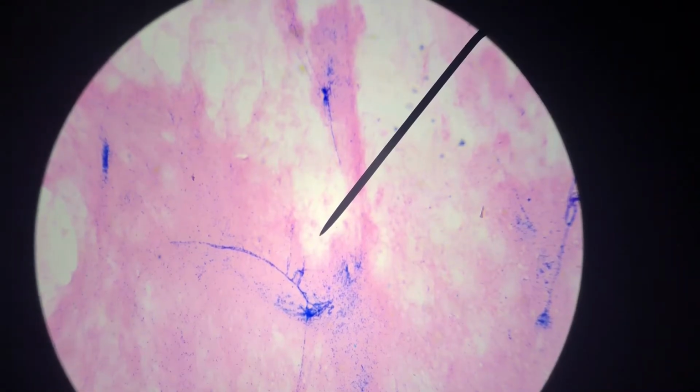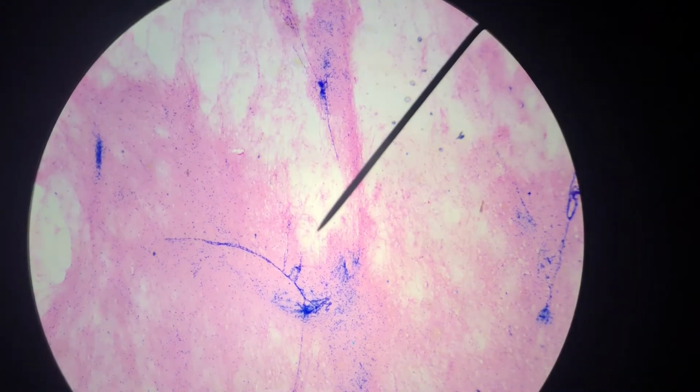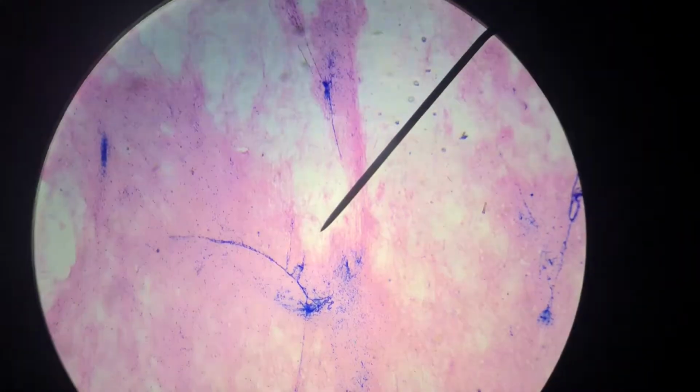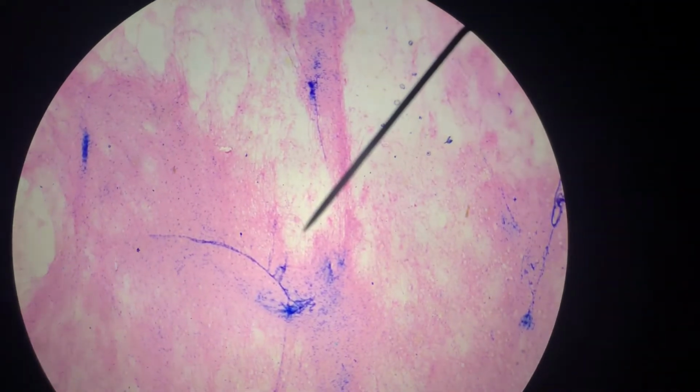You don't really have a nervous tissue lab, but nervous tissue is super cool. So I'm gonna tell the professor she should give you a bonus nervous tissue question. What you're looking at here is a multipolar neuron. And, oh, come on. The pink stuff, I can't move my hand. The pink stuff are all the glial cells. The purple is the neuron.